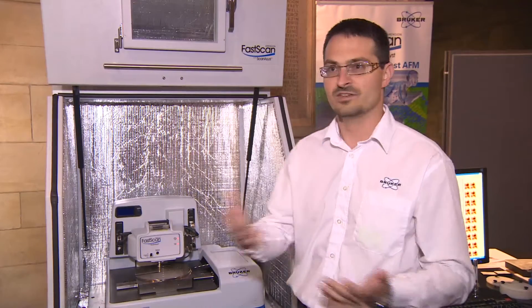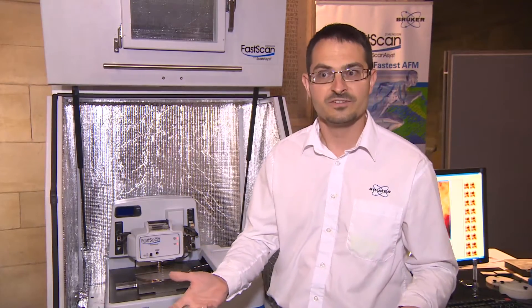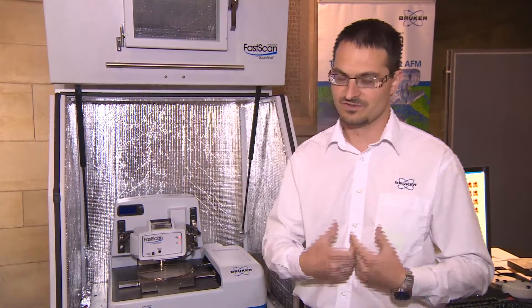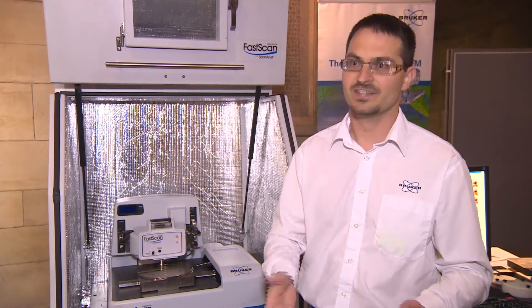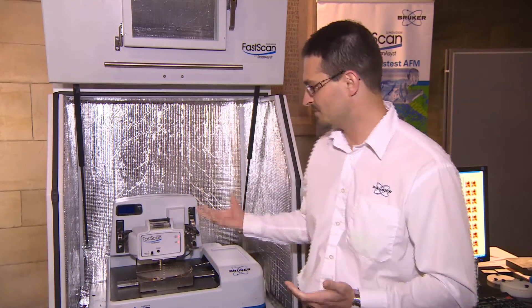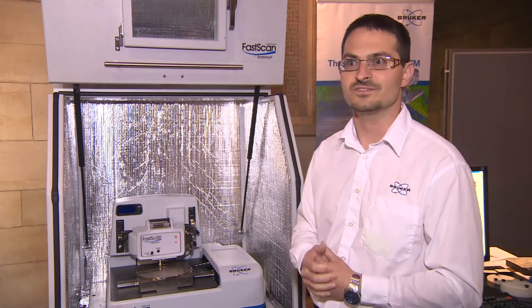You can have industrial people who are interested in high throughputs for quality control — we can think about the semiconductor industry or data storage for instance. You also have the capability to use the system in academia to study kinetics like biodynamics, living cells, and bacteria in dynamic motion, under liquid for instance.